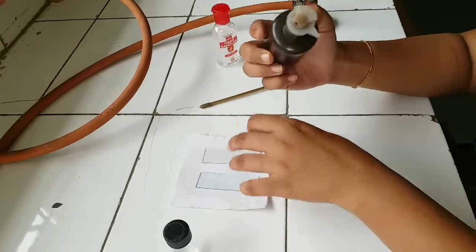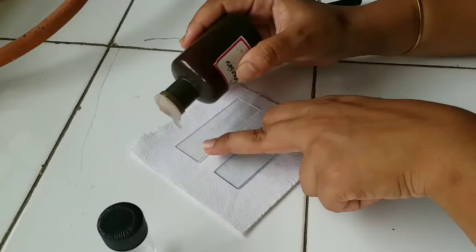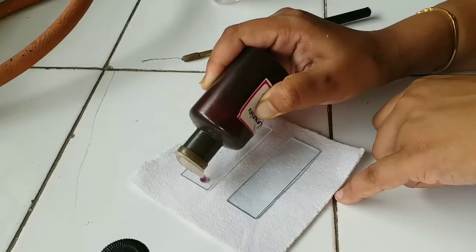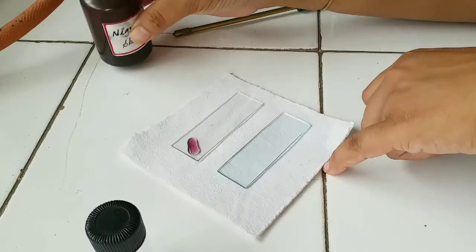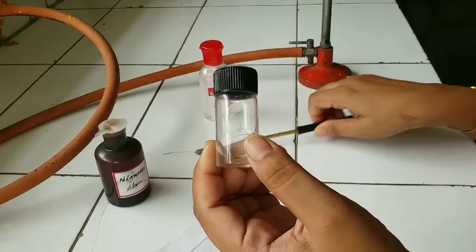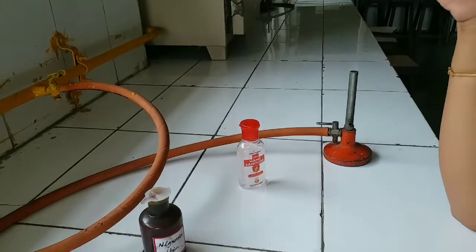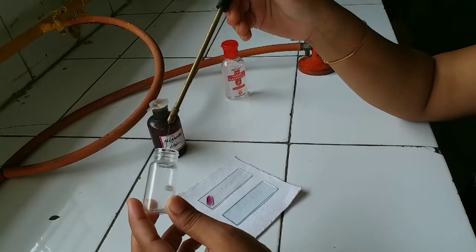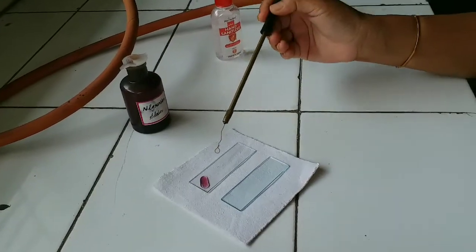So basically, this is the principle — in a dark background, the bacteria will appear colorless or transparent. Now for the procedure: first, you have to take a drop of nigrosin, then take one loopful of bacterial culture and place it on the side of the stain on the slide.